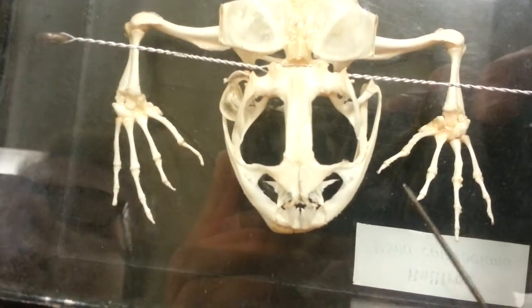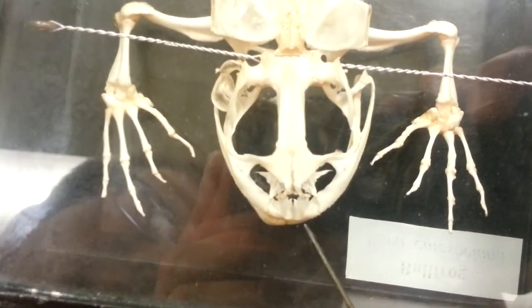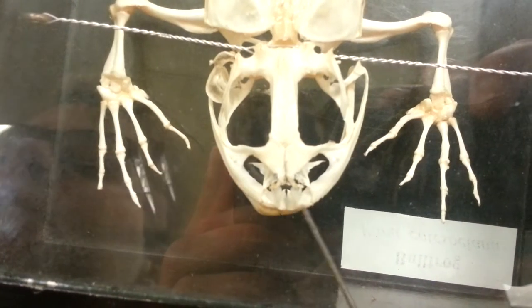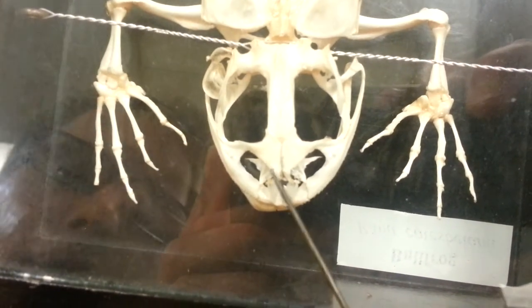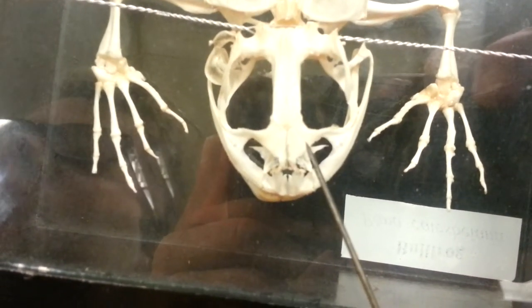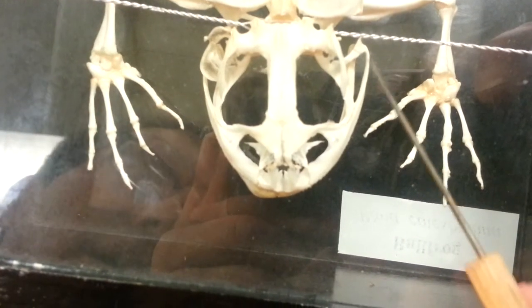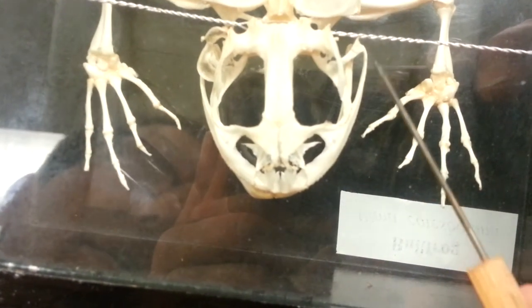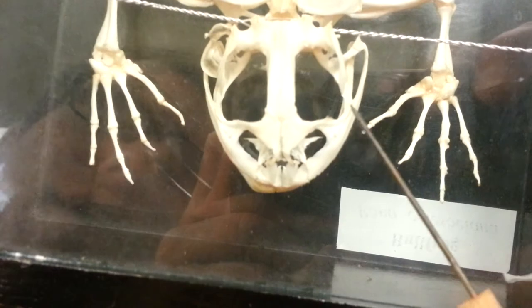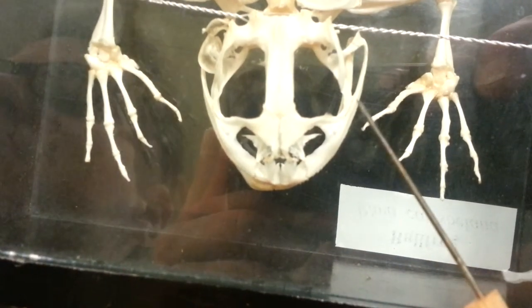Here's the frog skull dorsal view. Right here at the very tip, that's the premaxilla. These two bones right here are the nasal bones. The maxilla is the one that curves around here. The other curvy one that's on the inside is the squamosal.